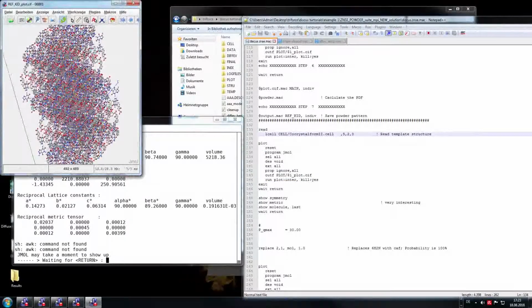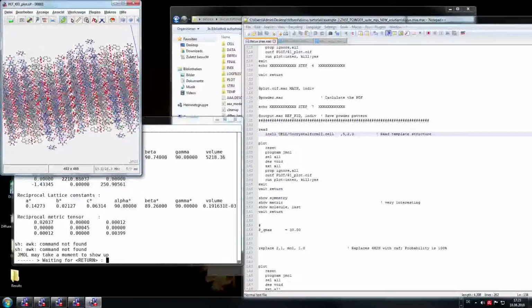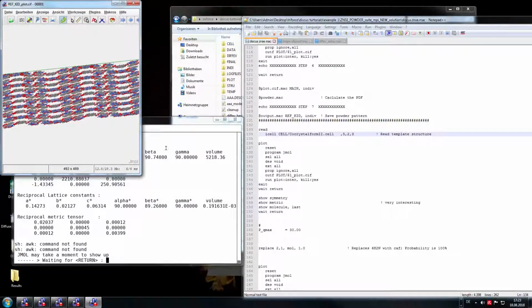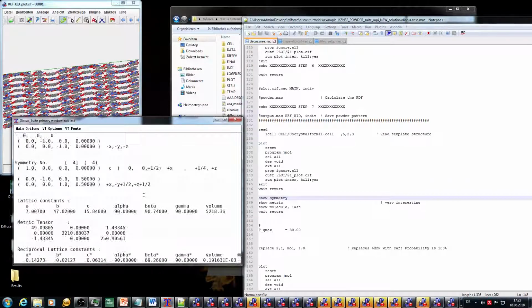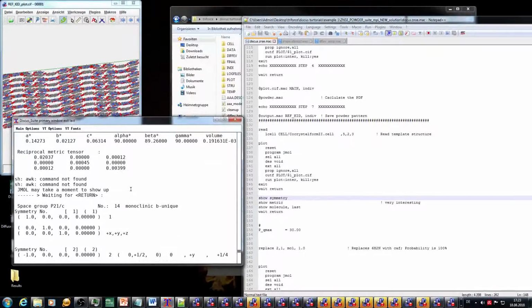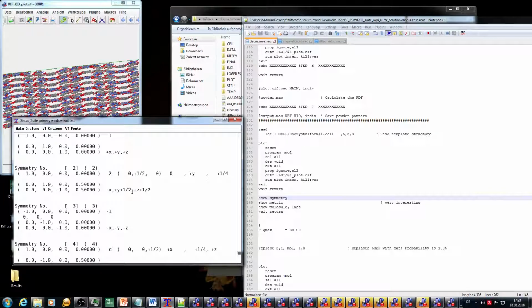Again, it's a mixture of naphthoic acid and caffeine here in bluish. It's kind of a wavy structure, stacked also layers. So what I'm going to show you first is the show symmetry and show molecule command, or respectively the show atom command. Here is the show symmetry command. The symmetry of this co-crystal is P21/c, so it's a monoclinic structure with all the symmetry operations written down in here.